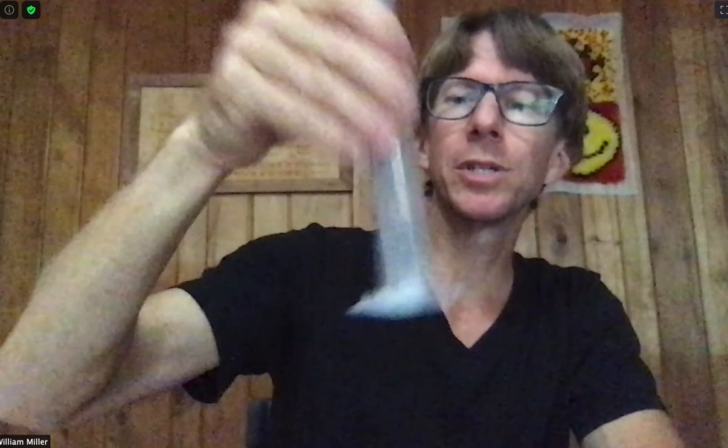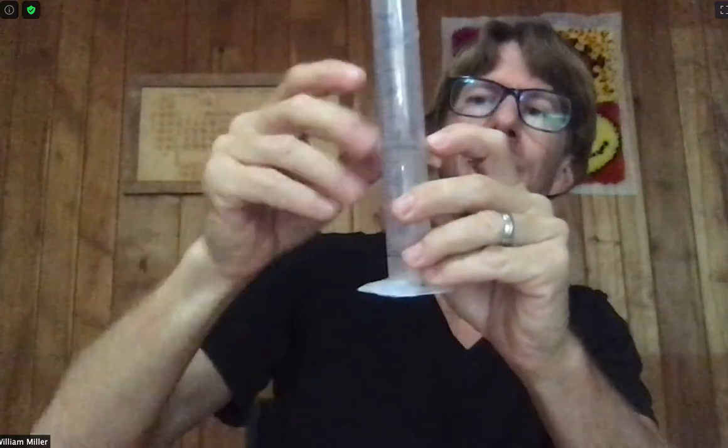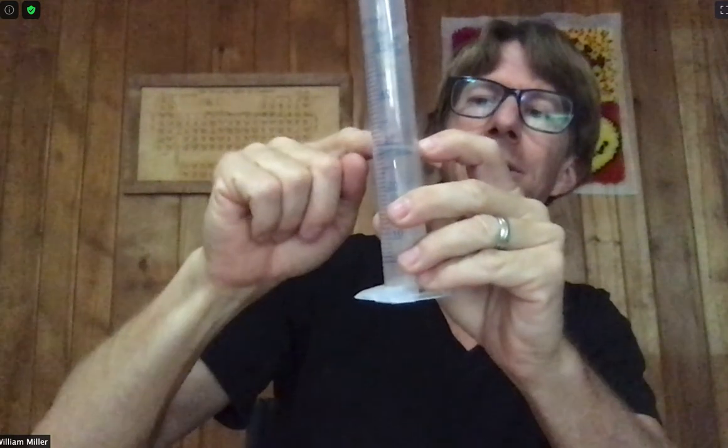I have five grams. I've chosen sea salt, which has some big grains. The smaller the grains of salt, the faster they will dissolve, so mine's going to take longer than most. I'm going to swirl it. Fortunately, as I swirl it, my water will stay in here. It is relatively easy to keep from spilling your solution.